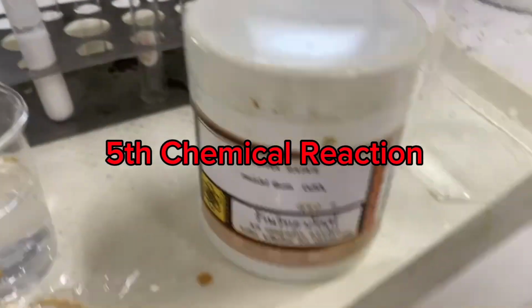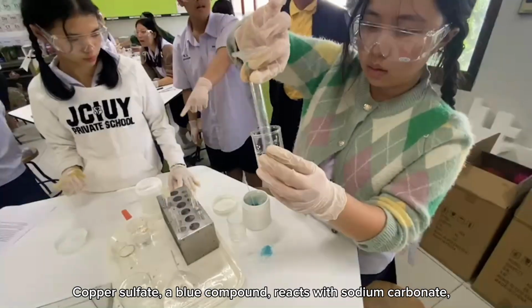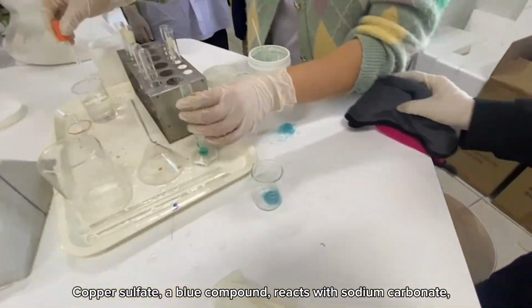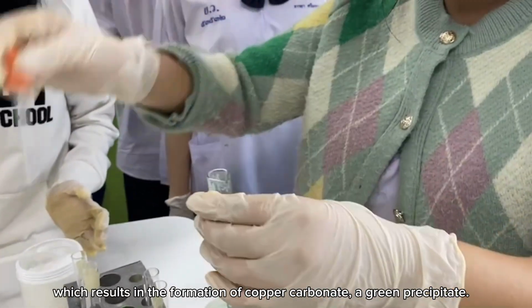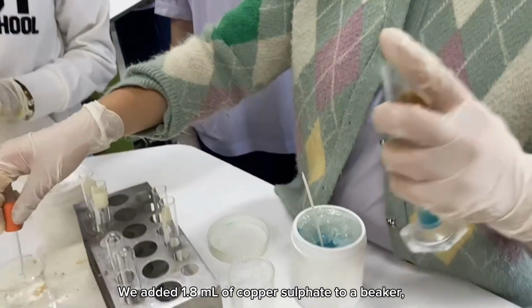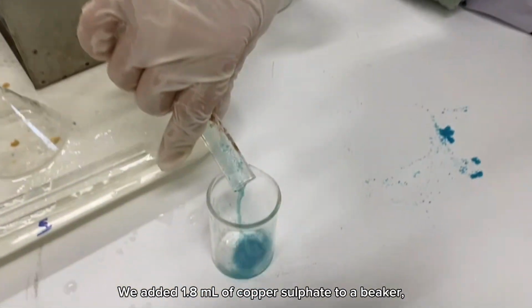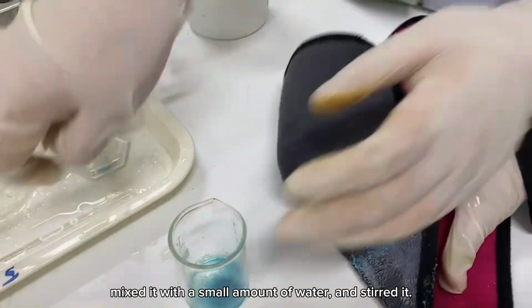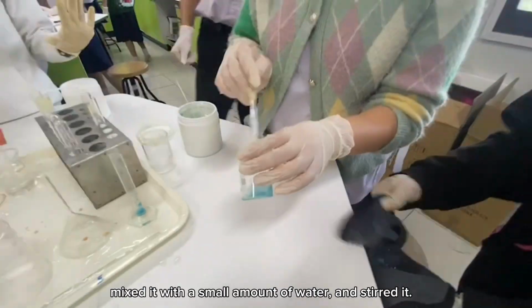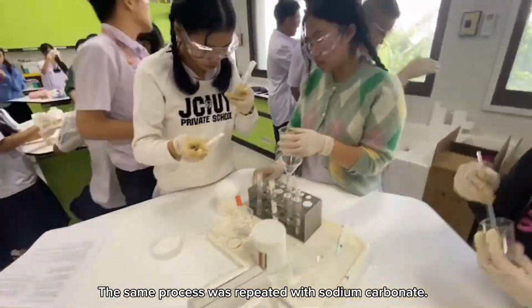Number 5, copper sulfate and sodium carbonate. Copper sulfate, a blue compound, reacts with sodium carbonate, which results in the formation of copper carbonate, a green precipitate. We added 1.8 ml of copper sulfate to a beaker, mixed it with a small amount of water, and stirred it. The same process was repeated with sodium carbonate.